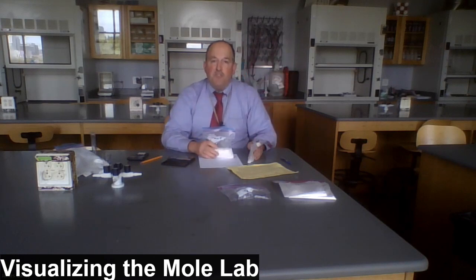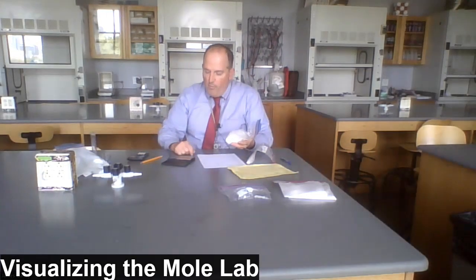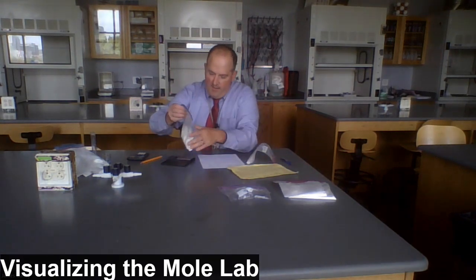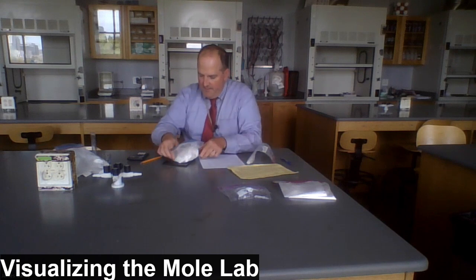So again, let's first weigh these samples. We'll note their weights, and then we'll do a little board work and come to a conclusion. So sample A, I'm going to carefully set it on the scale here.